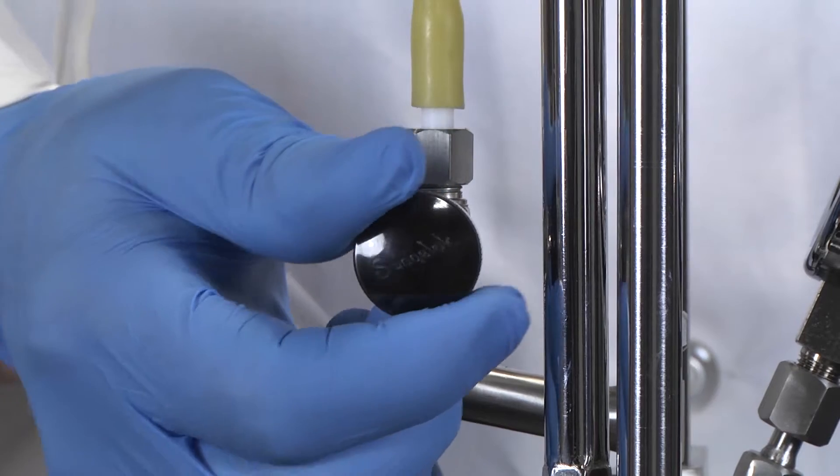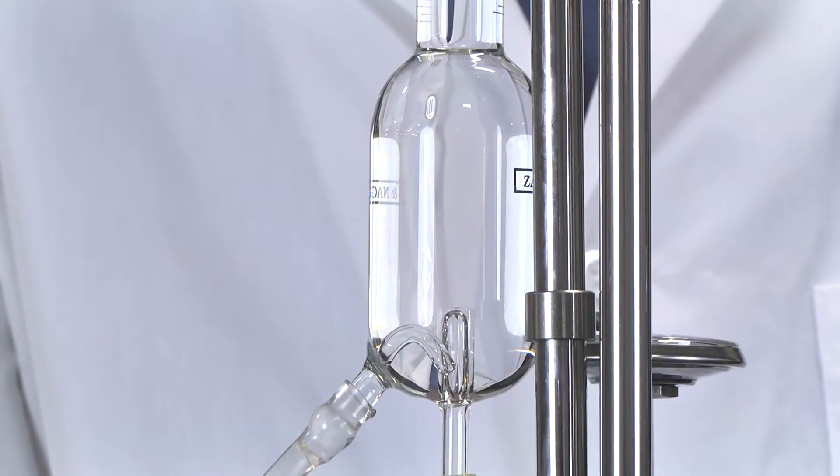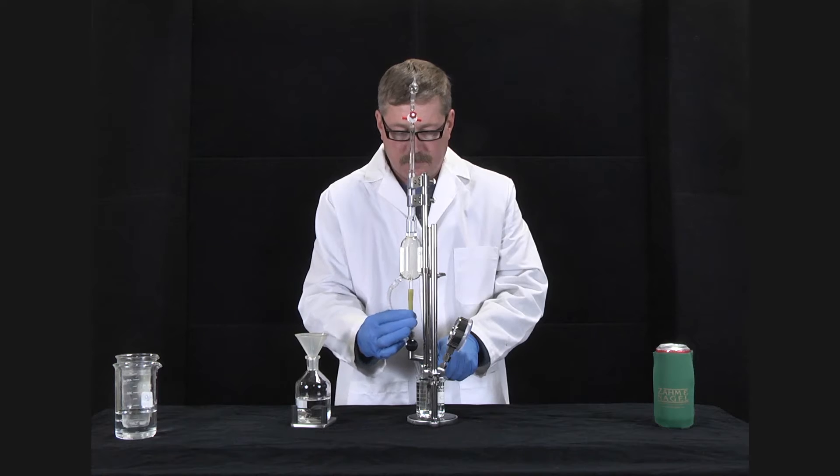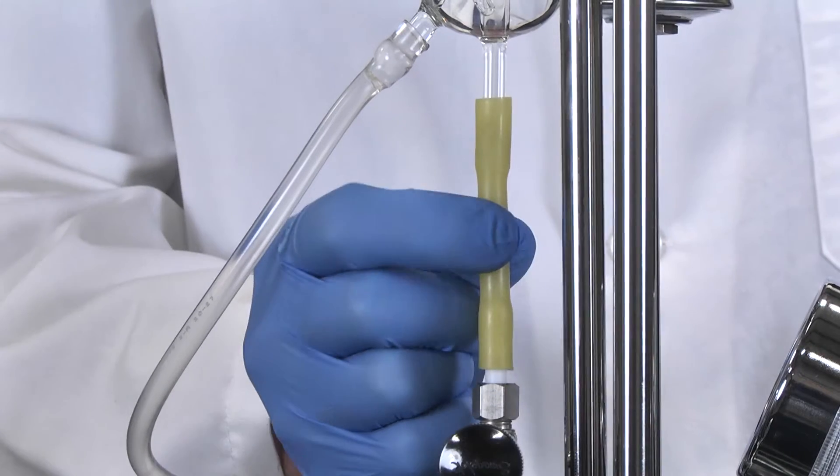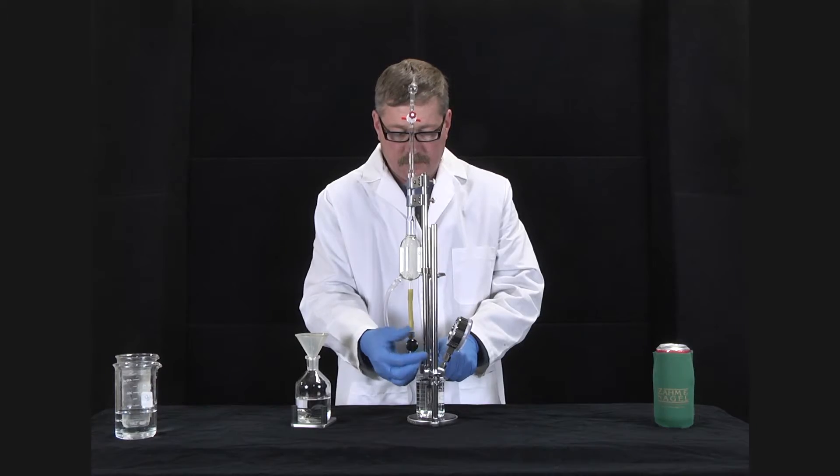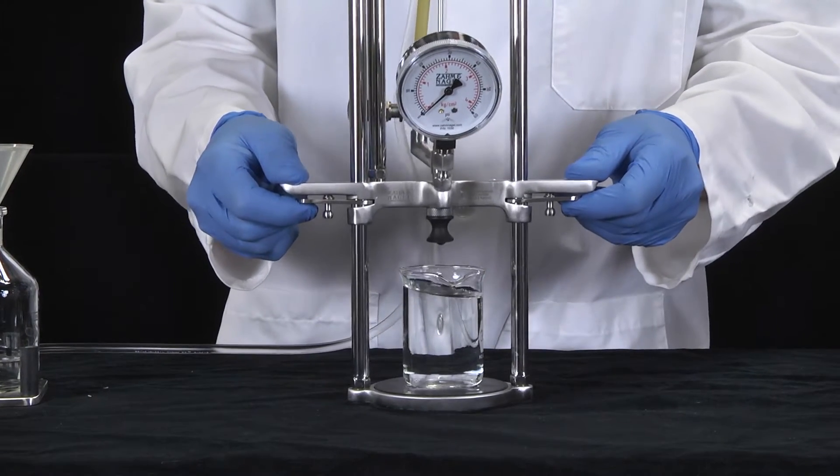Open the whitey valve. This will cause the water to be drawn upward through the whitey valve, displacing any trapped air in the system. Tap the amber latex tubing to release trapped air. Close the whitey valve and remove the beaker from the piercing needle.